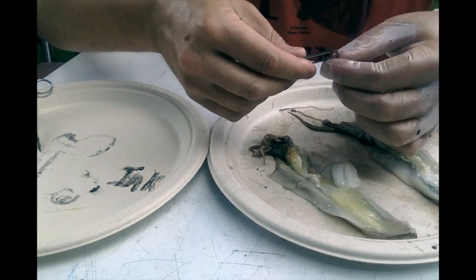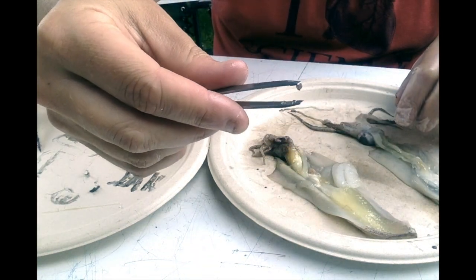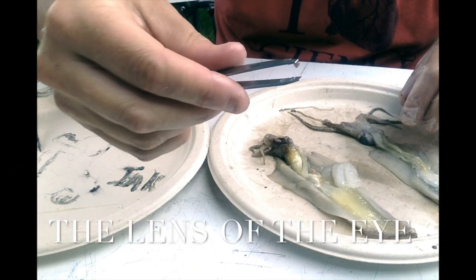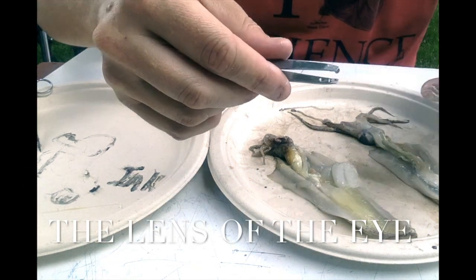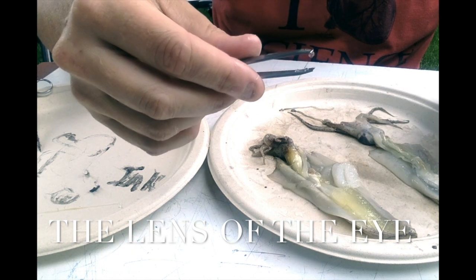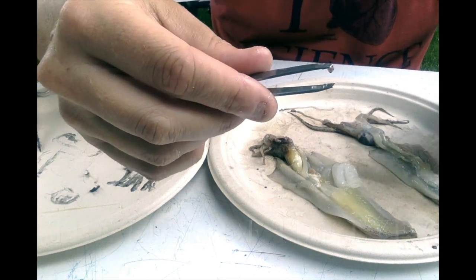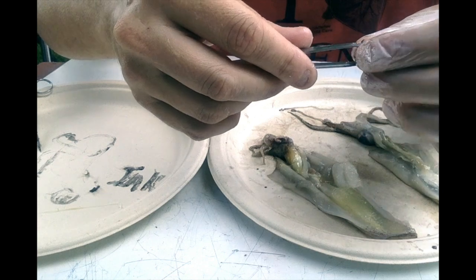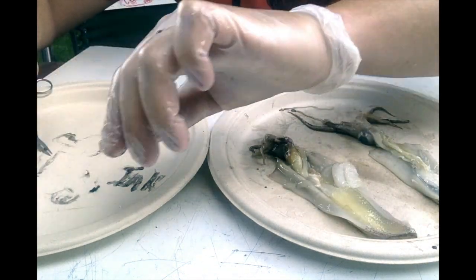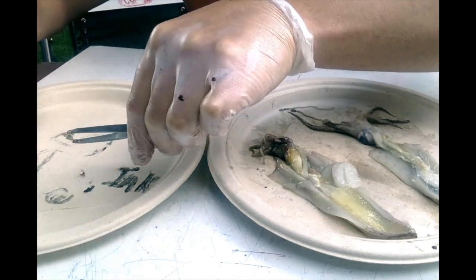And what I have here, sticking upside down to the tip of my tweezers, is the lens of the eye, just like the lens of our eye. And this is a hard structure that feels like plastic. It's not plastic, it's made out of cells, but it's pretty cool. And when you dig into the eye, you can find this little bead, which is actually the lens of the eye. The squid stuff is pretty sticky.